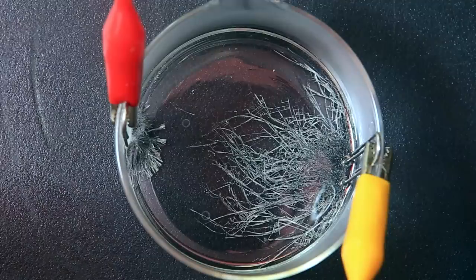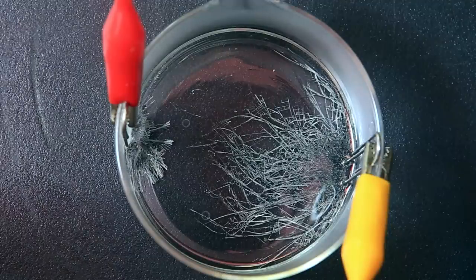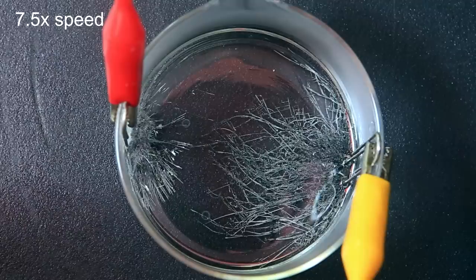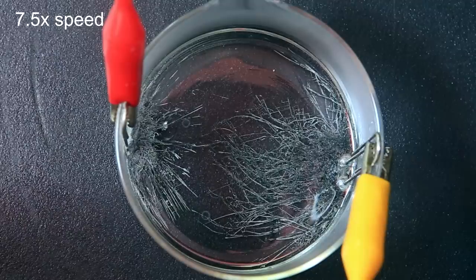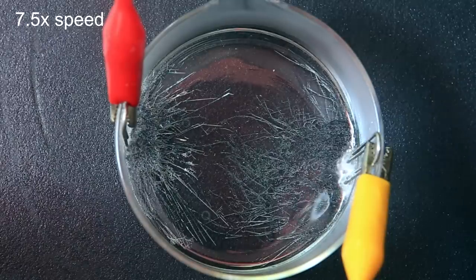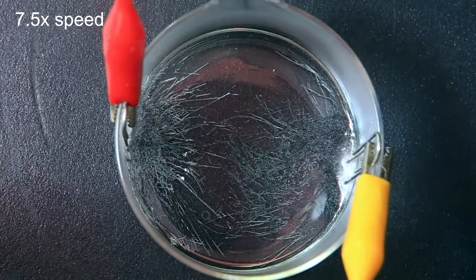Because this solution has already been used extensively and it's pretty hot, the demonstration isn't the most beautiful thing ever. But in essence what we're seeing here is the tin metal is giving up two electrons to form tin 2+ or tin 4+, which can redissolve in the solution.